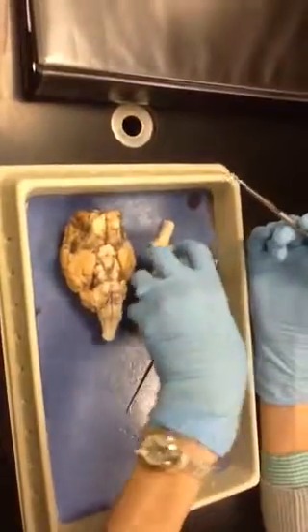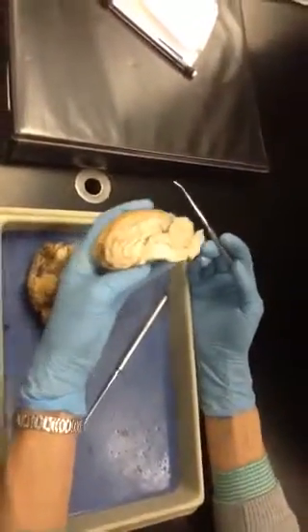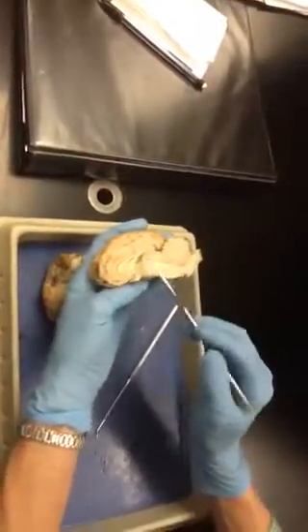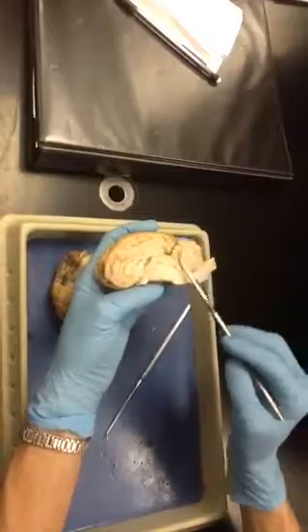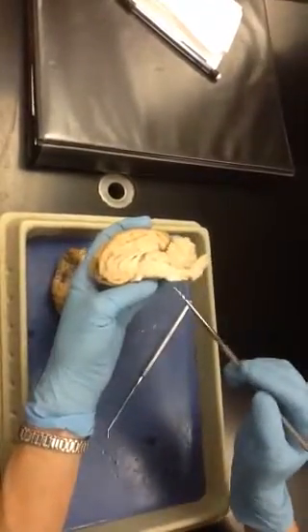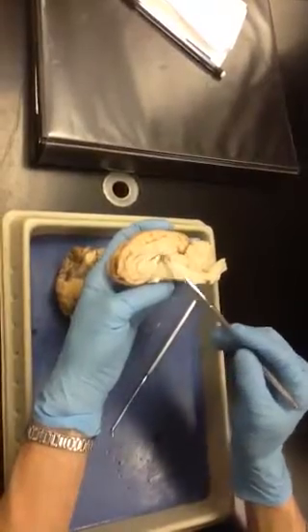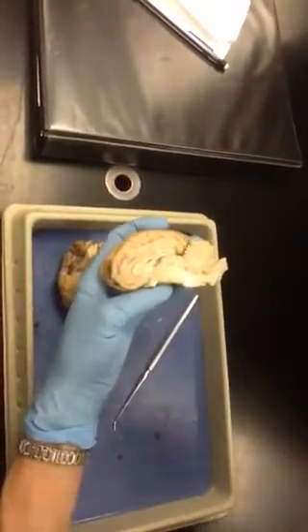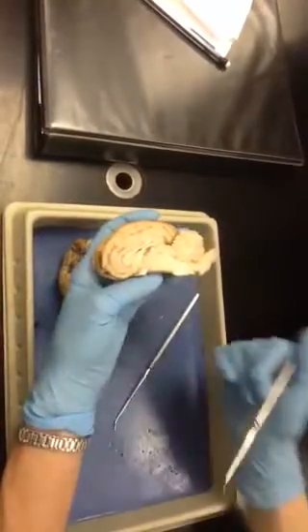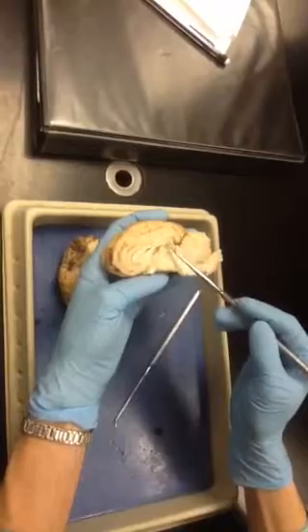If we look at a section of the brain, so now I've cut it along that longitudinal fissure, and we can look at the inside. This is cerebrum here. This is the cerebellum, the arbor vitae, the tree of life. Okay. This white band right here is called the corpus callosum, and that is a band of nerve tracts that run back and forth on either side of your brain. This end up here is called the genu. This end down here is the splenium.